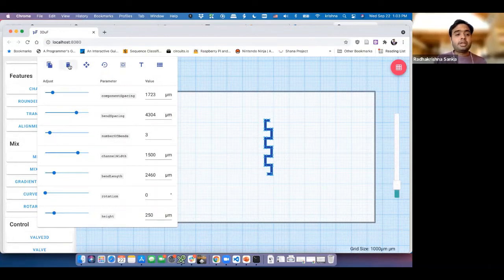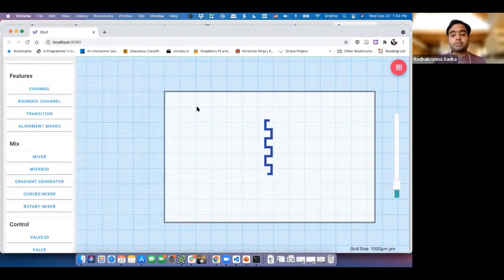Similarly, you can copy, delete, move it around, and you can do a bunch of different things with it or make arrays out of it. For now, we'll not be going into any of that, but I'll be showing you all quickly how to make this new component in the code.